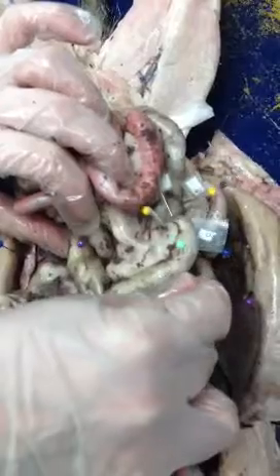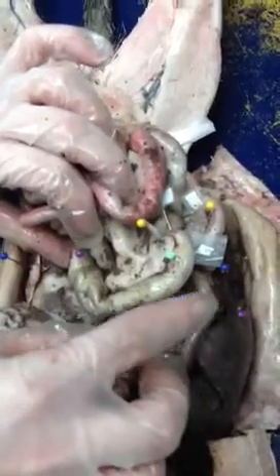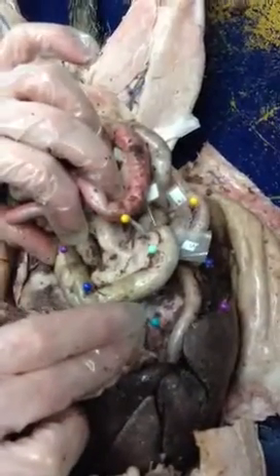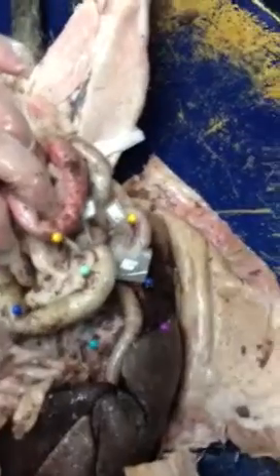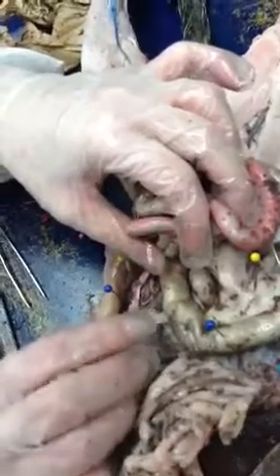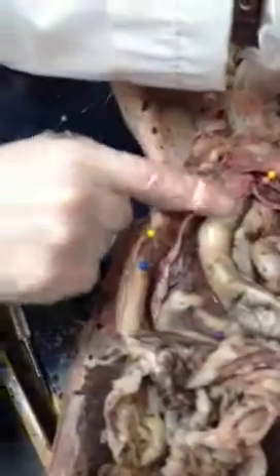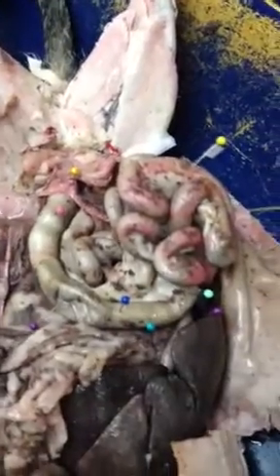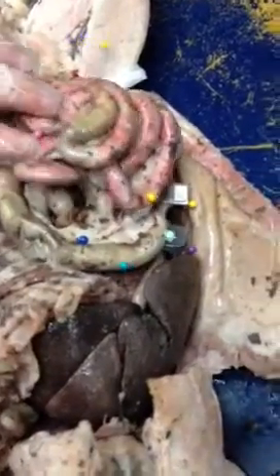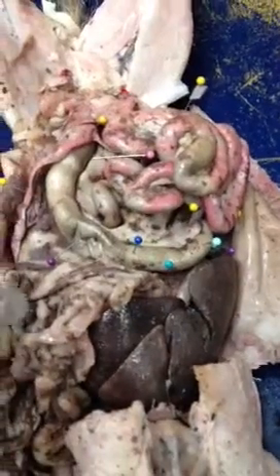If it was here and said curve, then that's the hepatic flexure. If it was pinned here, that's the transverse colon, because it's going more horizontal. If it was here and said curve, that's the splenic flexure. Anywhere down here would be your descending colon. So where there's a curve, and between is the transverse. Hepatic for the liver and splenic for the spleen: hepatic, transverse, and splenic.